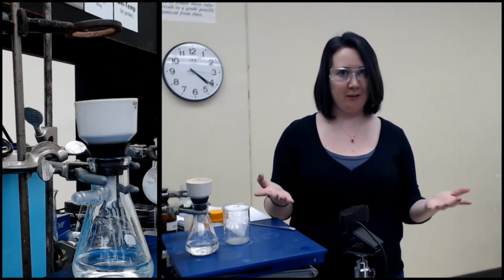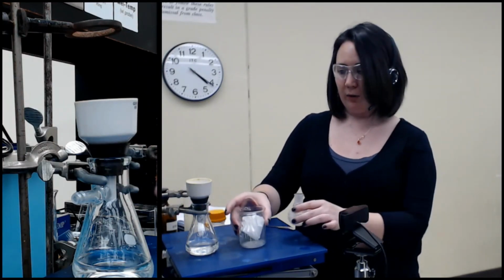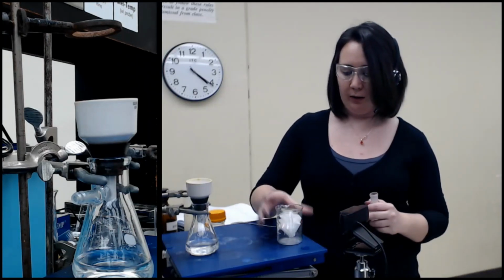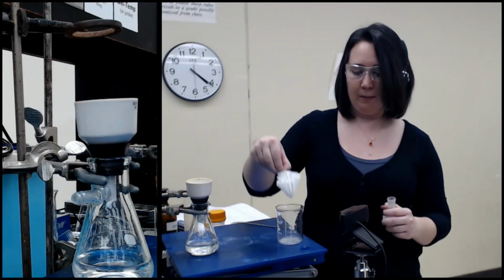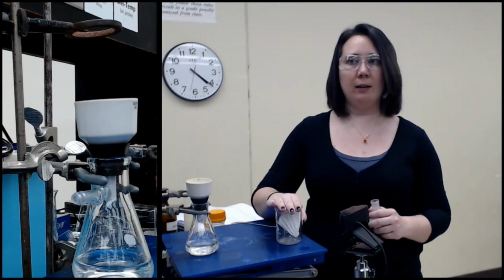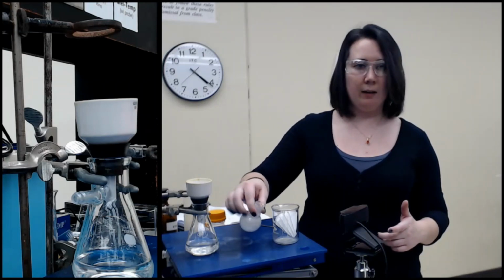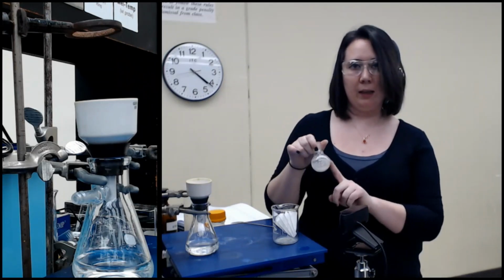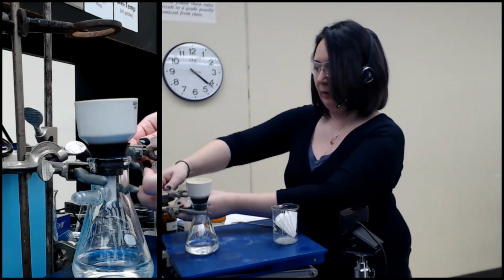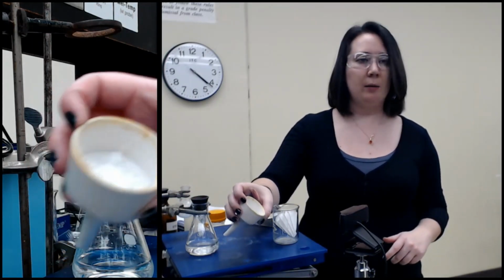Okay, so we are just about done with our extraction experiment. I'm done for today at least, and tomorrow I'm going to take the mass of each one of our solids. Let me go in order here. I have solid in this fluted filter paper that I will be weighing. That was the solid that did not dissolve in ethyl acetate, the first one I collected. Then this is the solid in the round bottom that I put on the rotovap. This was what was left in the organic layer after our extractions. So I'll let that sit here. And then what I have in the Buchner funnel is the solid that was in the aqueous layer.